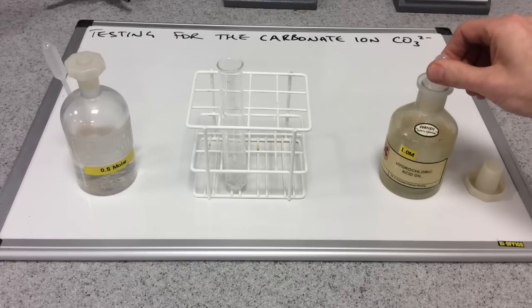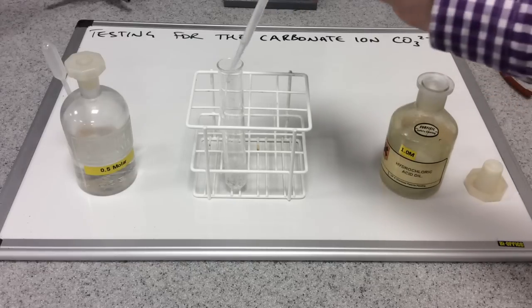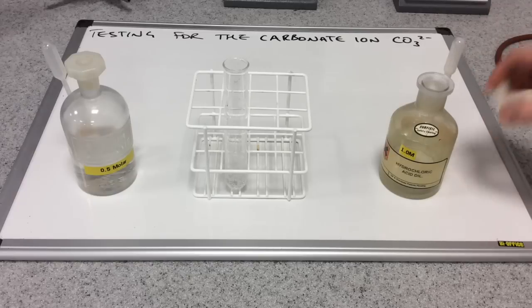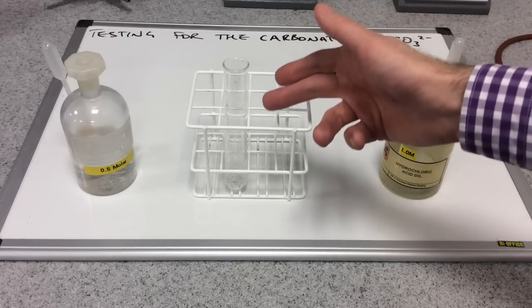So you can see there's definite bubbling there, fizzing going on. And so that's actually the test for the carbonate ion. You add some acid and you get fizzing.